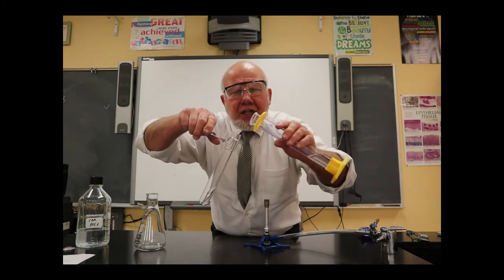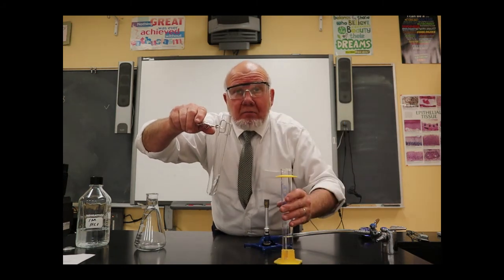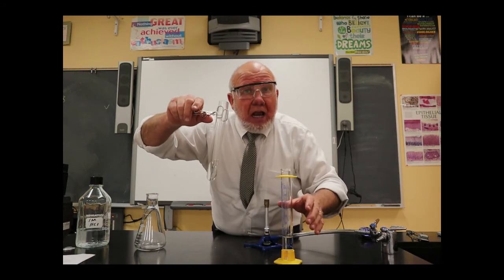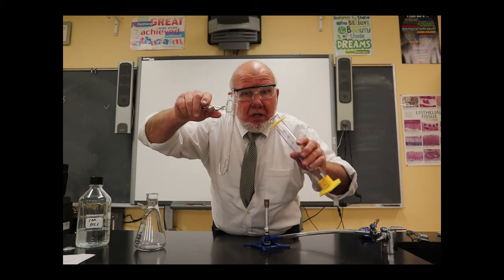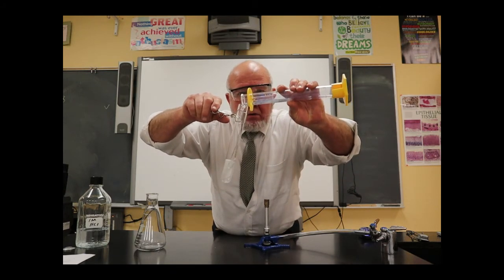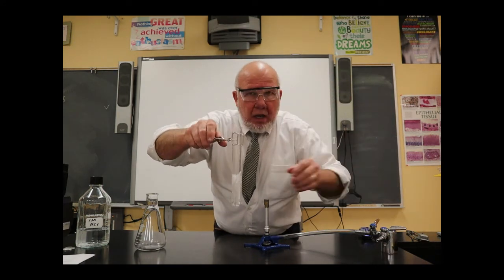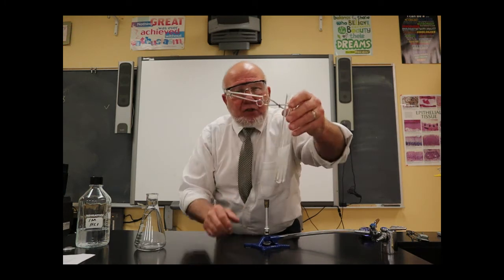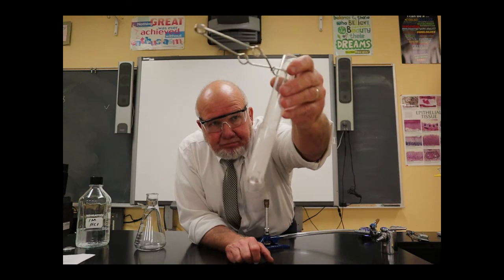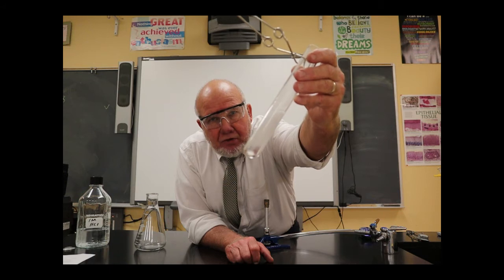And what I want to do is get a reaction going between the magnesium and hydrochloric acid. Now, actually, what I want to know is when I'm going to form a new compound, you'll see a reaction. You'll see evidence of a chemical reaction going on right now as I pour the acid in. There we go. And I don't know if you can quite see that. Let me hold it this way. So there's some evidence of chemical reaction going on there. What do you see that would indicate to you that chemical reactions are occurring?